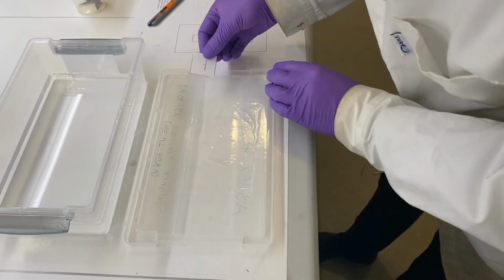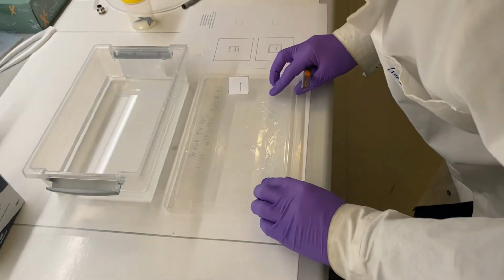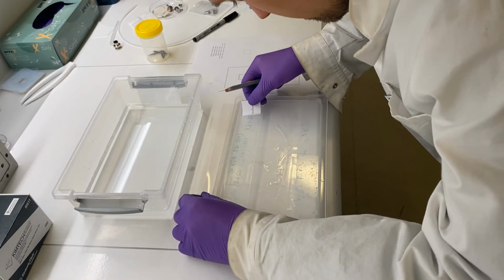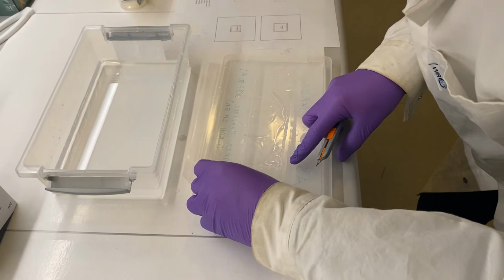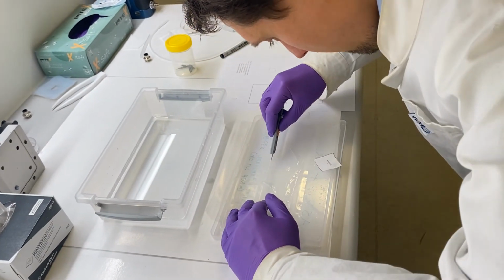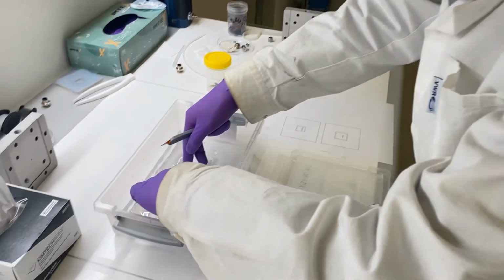So I put it down here, and then I have a small paper giving me the size. And again, I'll just put it next to it, use the knife, and then I know kind of where to cut. So I will use the line here. And then I'll hurry up, putting down the last piece.